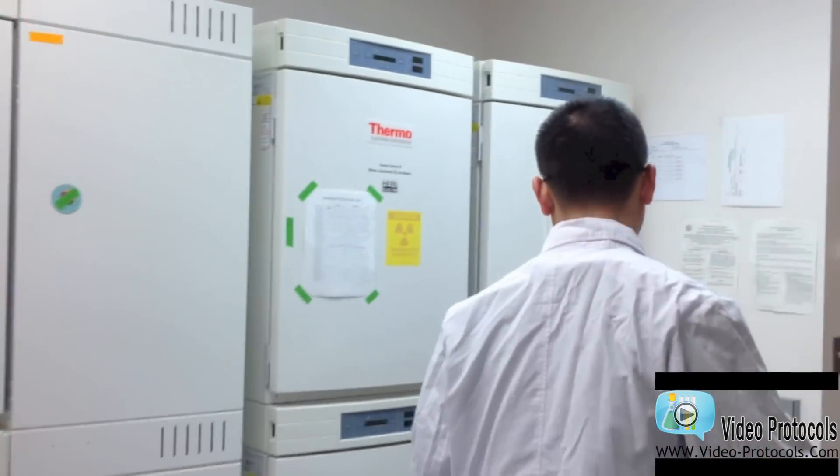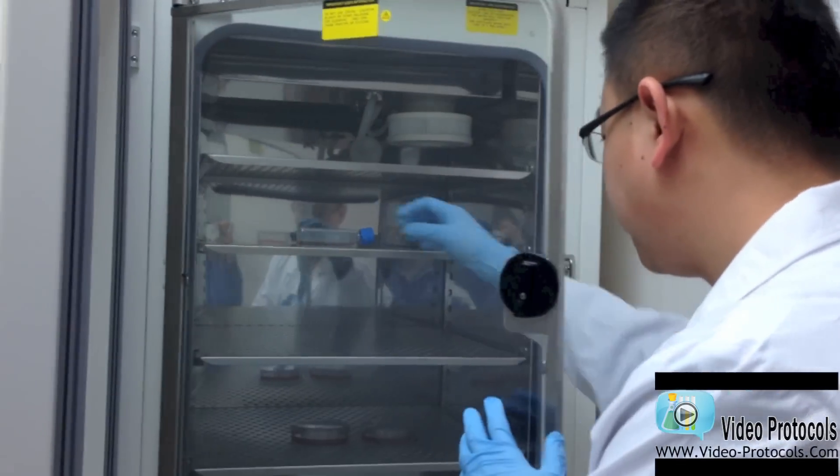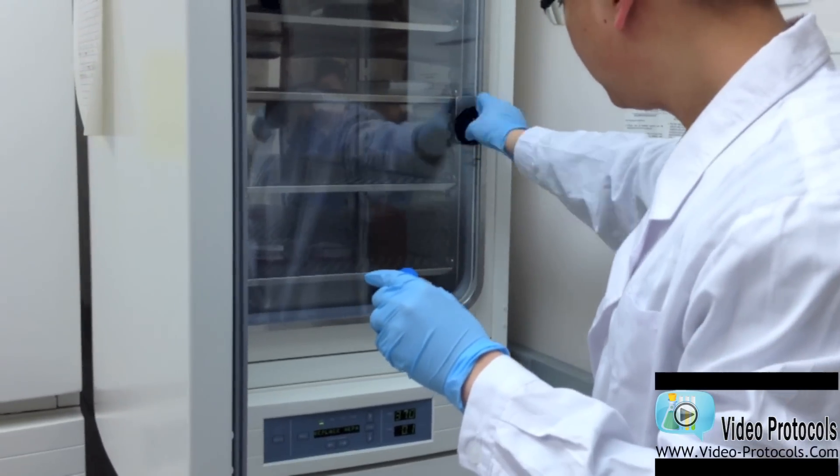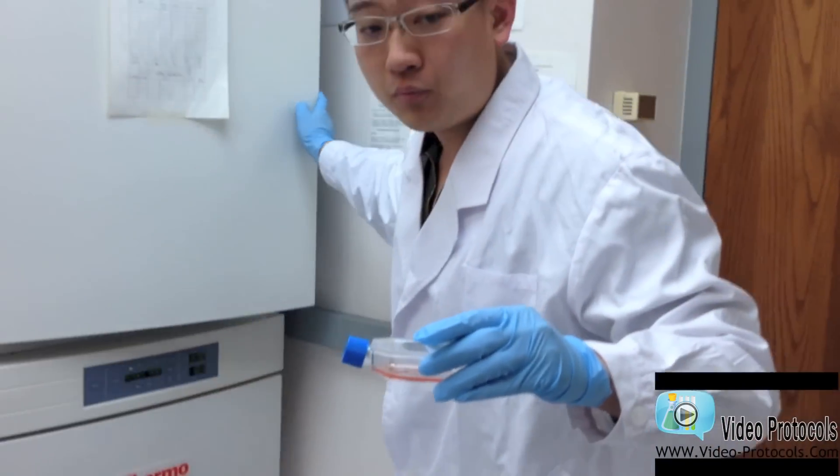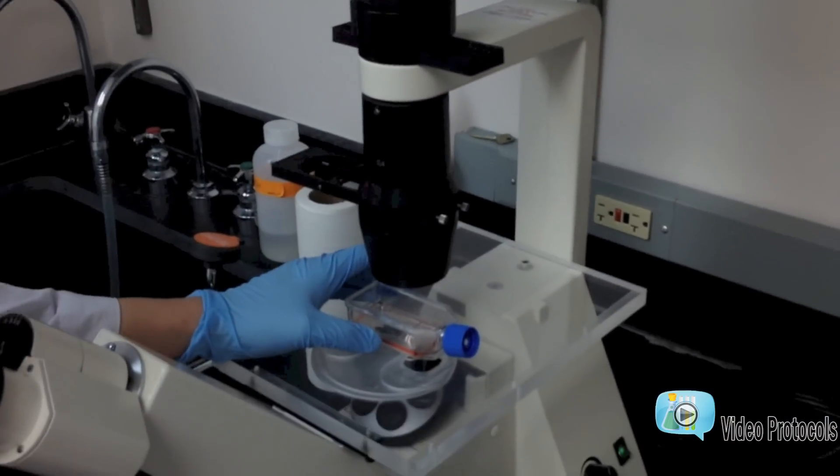The first step is you take the cells out of the incubator. You will normally take a look under the microscope to make sure they are healthy.